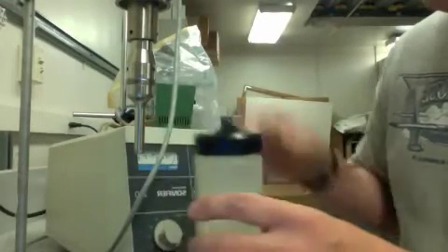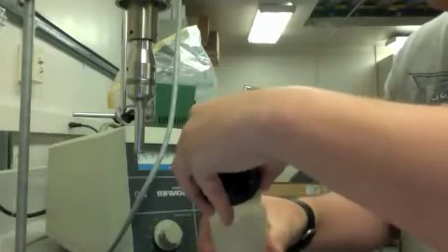I'll show you how this works, but you will definitely need to wear ear protection. It will end up holding your sample like this.